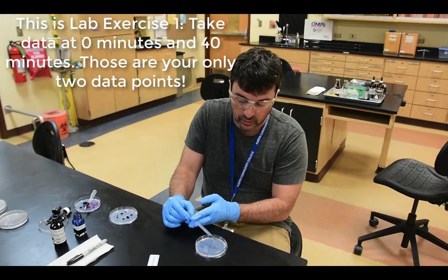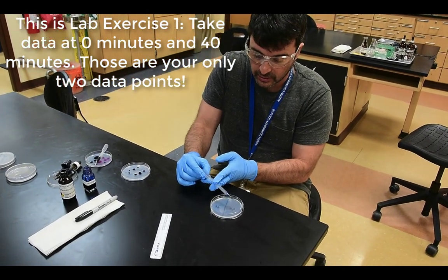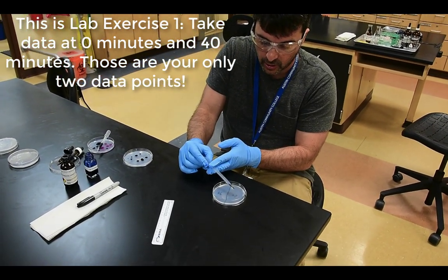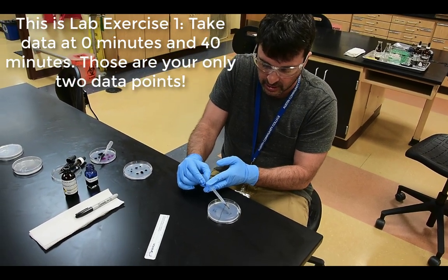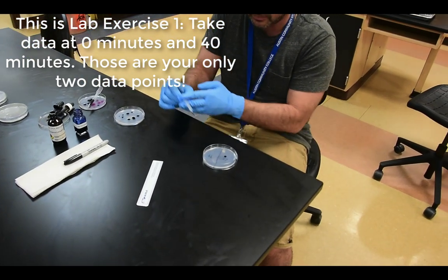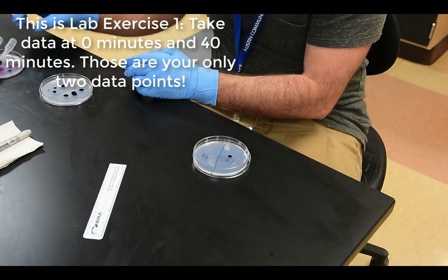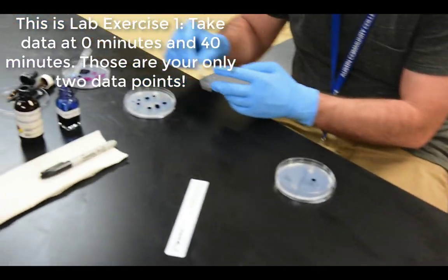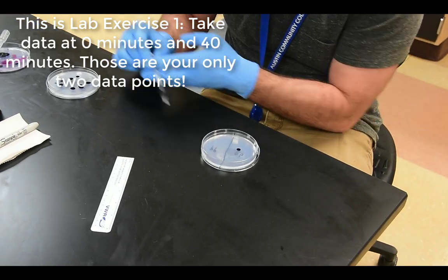Okay, so what I'm going to use to introduce the methylene blue is a little micropipetter. That's what this plastic tool right here is called. It can be very hard with the dropper sometimes to get a consistent dot, and I just want a little dot of methylene blue on here to measure initially. So there's our dot of methylene blue. Notice that I have a few errors over here in practice because this can be a bit tricky to do. We're trying to standardize our dots as much as we possibly can.